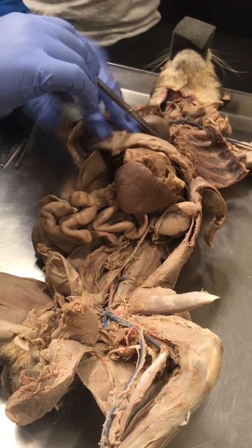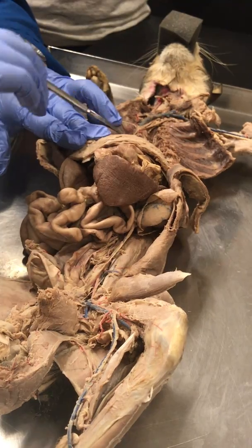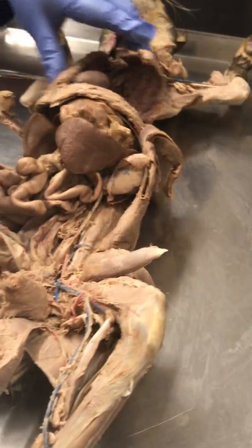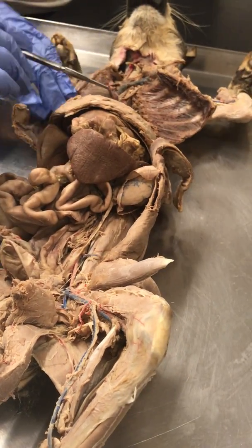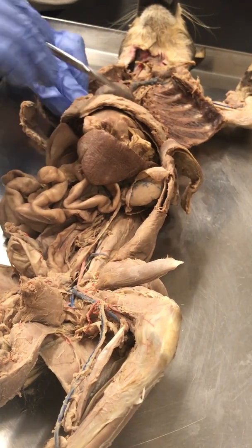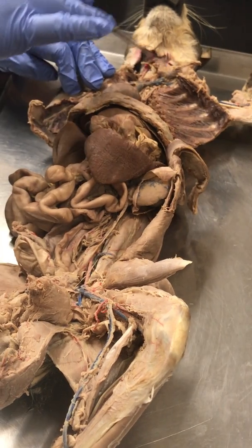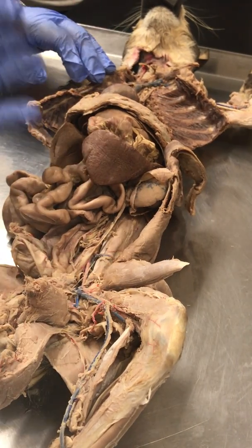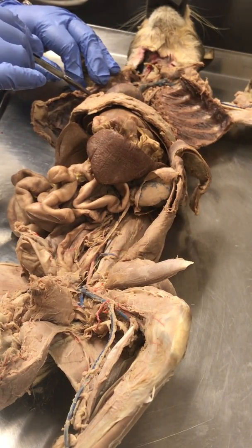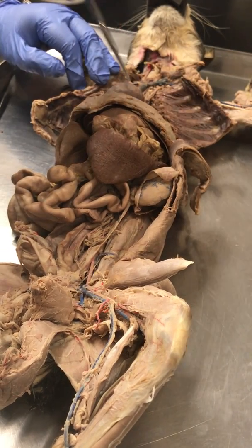The diaphragm, and that's what this thing is, right? And then you know the diaphragm itself is innervated by this nerve, and that is the phrenic nerve right here, right? Now, when we take a breath, the phrenic nerve will send a signal to the diaphragm. The diaphragm will contract, thereby pushing the organs a little bit downwards, increasing the volume in the thoracic cavity, thereby decreasing the pressure inside the thoracic cavity. So there's lower pressure here, higher pressure on the outside, air is going to enter. Okay?